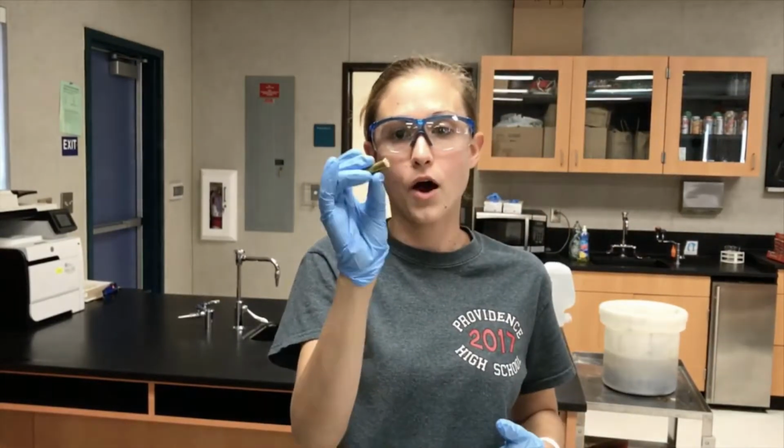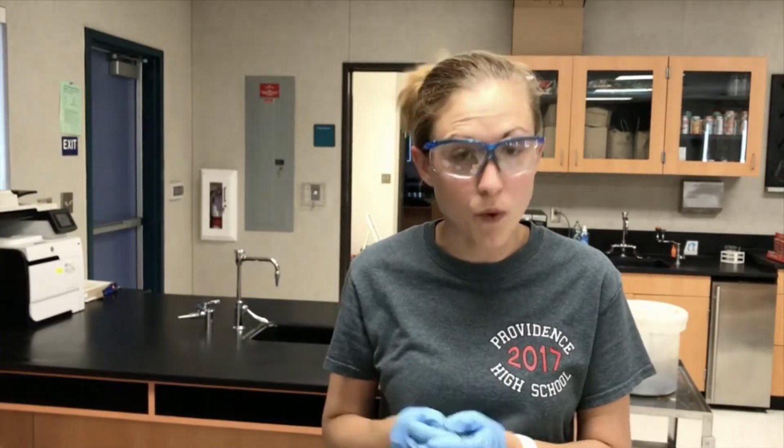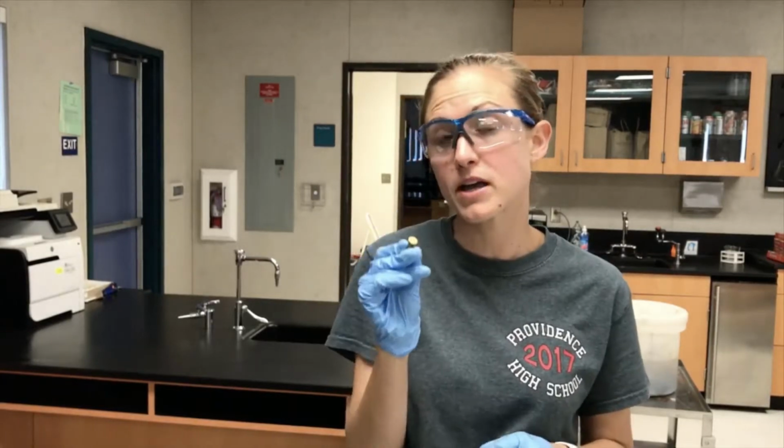So in this lab, we're going to be making a copper solution using our brass shell casing. And that's going to be blue in color, and using our spectrophotometer, which I'll show you in a second, we'll be able to determine the concentration of copper in the solution by finding absorbance. But in order to do that, we need to create a Beer's Law curve. And so that's going to compare concentration and absorbance, and we will actually create that curve.